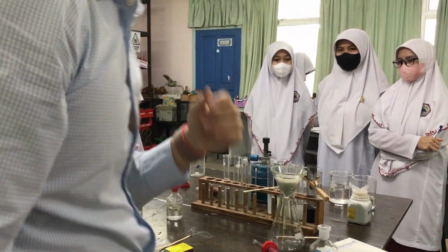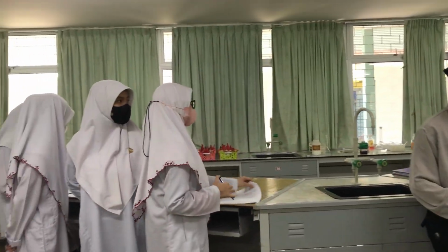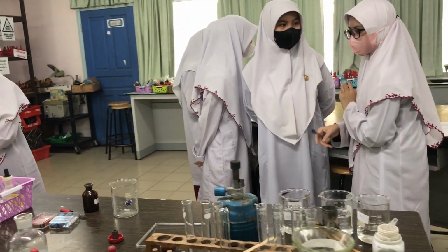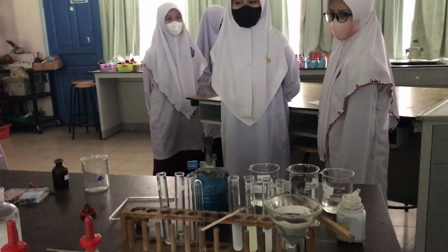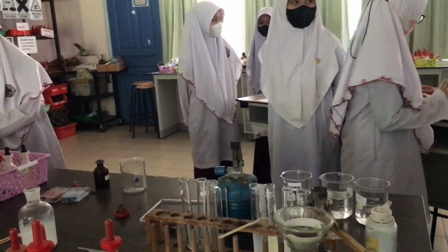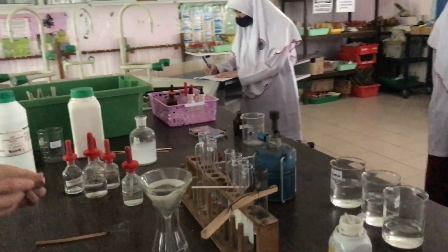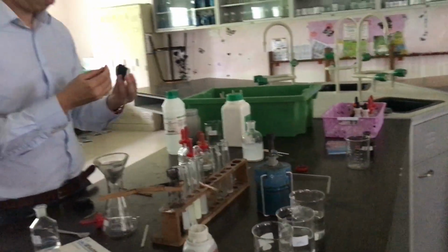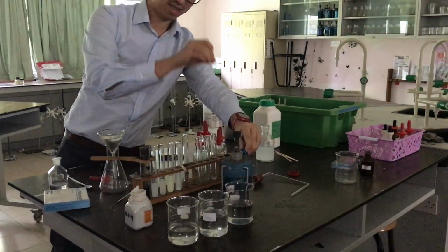Now the very last gas is chlorine. Am I correct? Yes. Now before you do chlorine, start the Bunsen burner for me. Start the Bunsen burner. Okay. Who doesn't know how to start a Bunsen burner? So everyone knows how to start a Bunsen burner? Wow. Let me just burn my face.